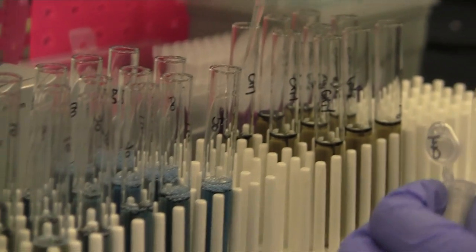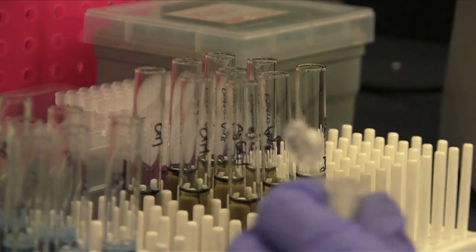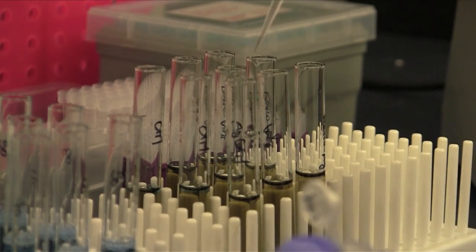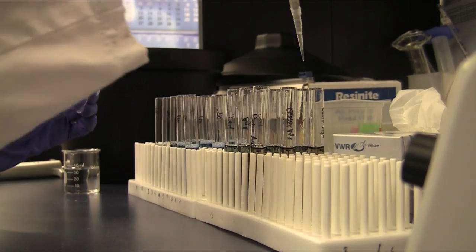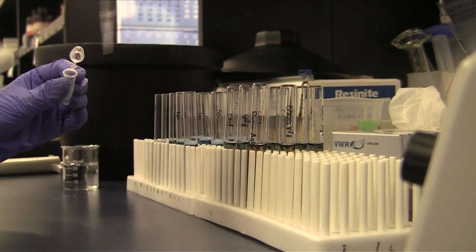Add 5 milliliters of stock Bradford reagent into a separate set of labeled tubes. Transfer 100 microliters of the BSA standards and 100 microliters of your test samples into a tube containing the Bradford stock reagent.